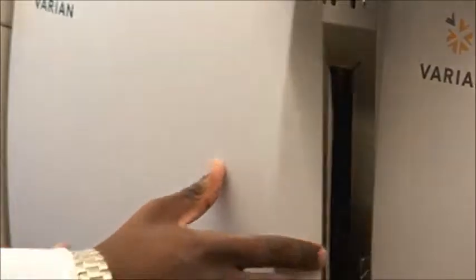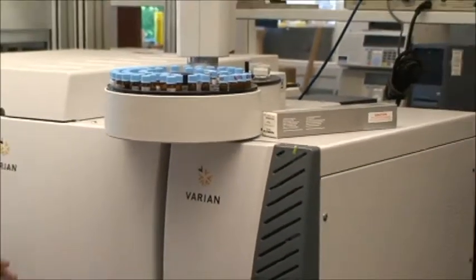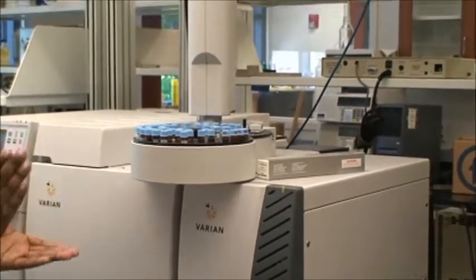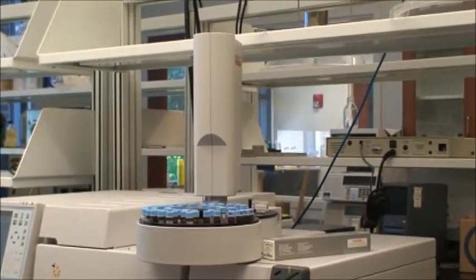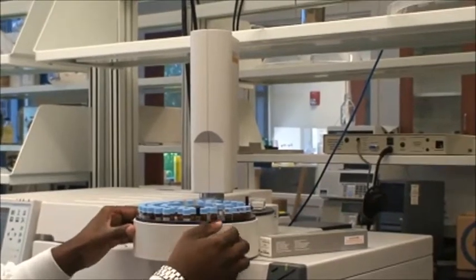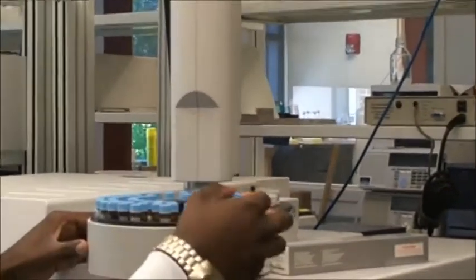This tube actually goes to the injection port, which is the next step. This automatic GCMS is a little bit unique compared to some models. If you look closely, you'll see that these sample holders have numbers.